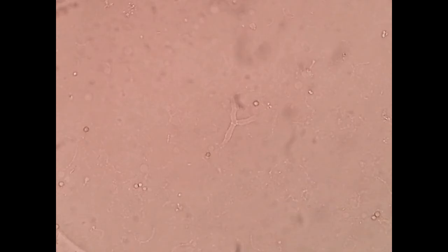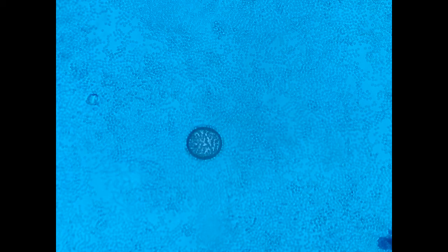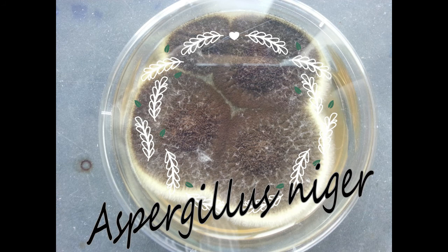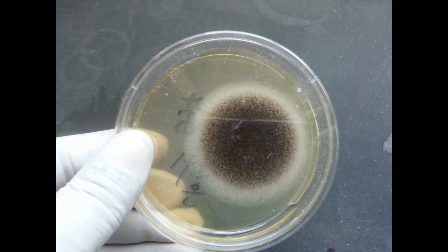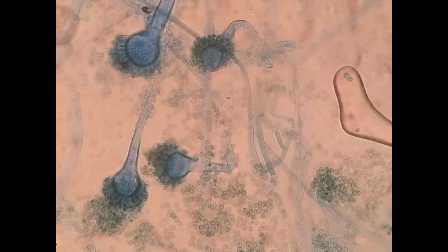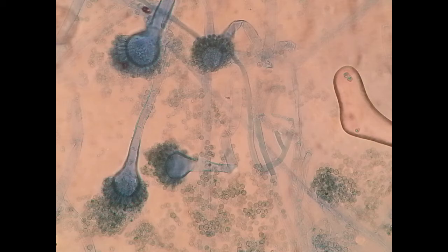Aspergillus septate hyphae with V-shaped septate branching with potassium hydroxide (KOH) preparation. Fungal spores on LPCB mount. Aspergillus niger on SDA — colonies are quite fluffy, covered with black spores. Colonies of Aspergillus niger on cornmeal agar. LPCB showing structure of Aspergillus niger: conidial head, conidiophore, vesicle and conidia.